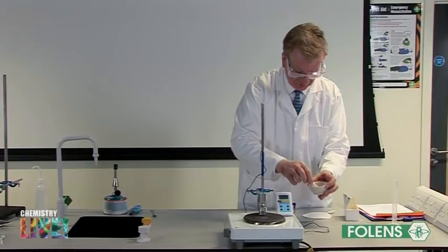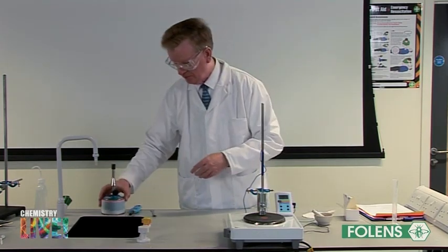Seal the end of a capillary tube by rotating it for a few seconds in the blue flame of a Bunsen burner.